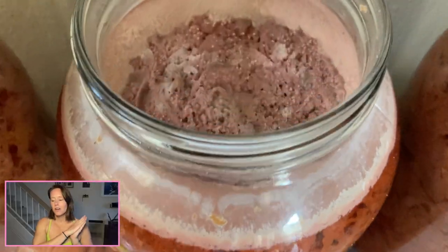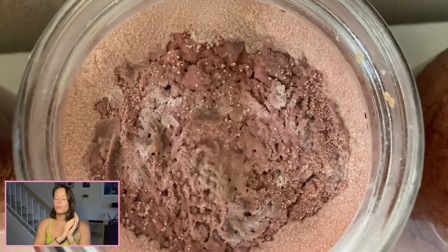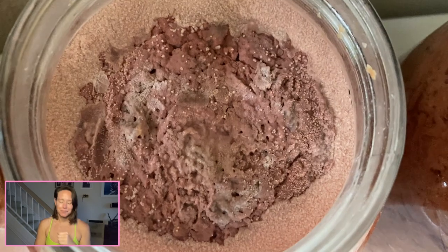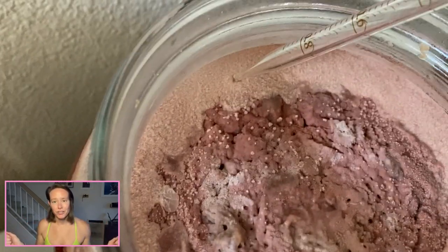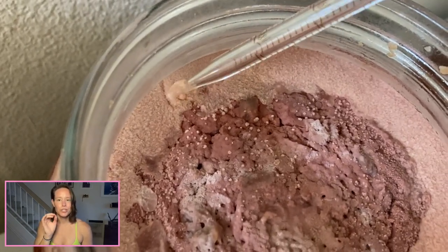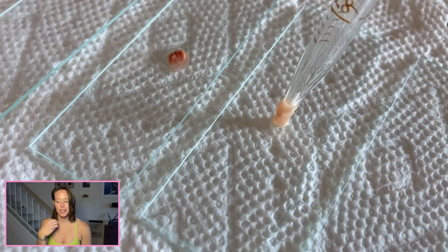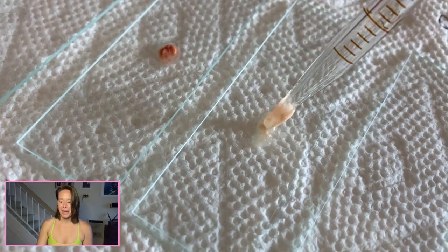So let's move on to the fermentation that was pitched using Red Star Premier Blanc. This one smells like nail polish remover. Acetic acid bacteria also produce ethyl acetate, which smells like nail polish remover. So I'm jumping ahead of myself, but perhaps there's some acetic acid bacteria in here.